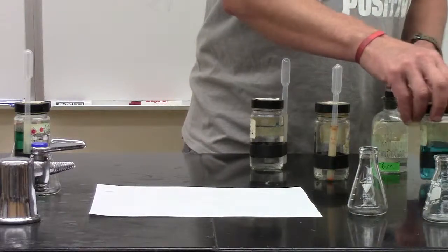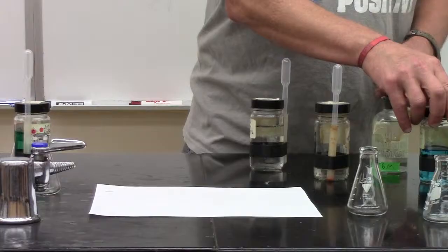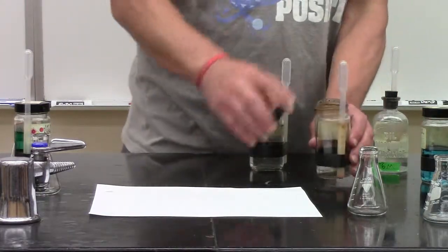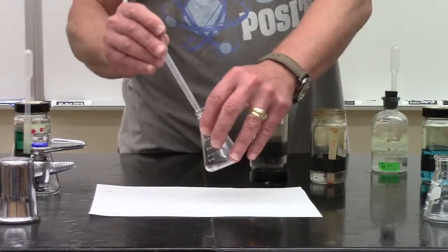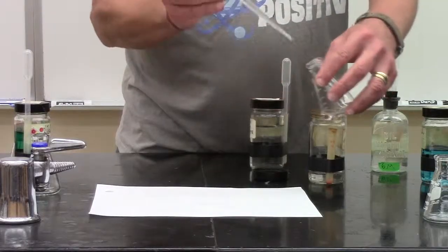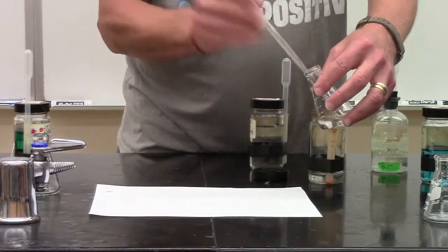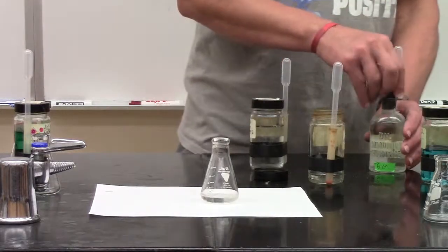I have a question. Yeah. So why when iron rusts does it only turn that red? That's when it combines. Well, let's take a look. You want to see iron rust? We can make iron rust. So let's go back to our iron that has no color. So you didn't like red or yellow for the iron. You wanted to see iron rust. Well, I'm going to make some iron rust.